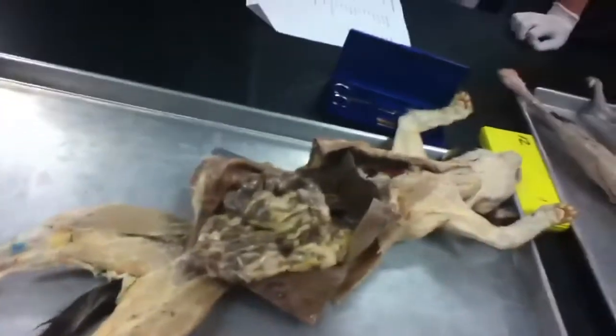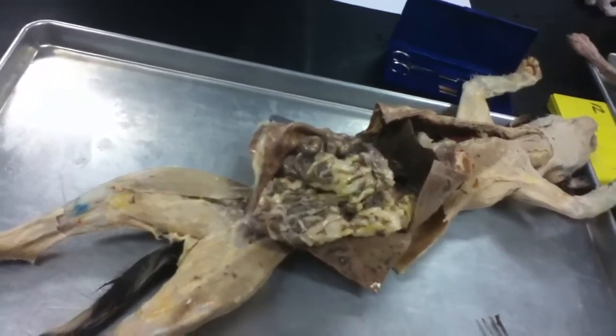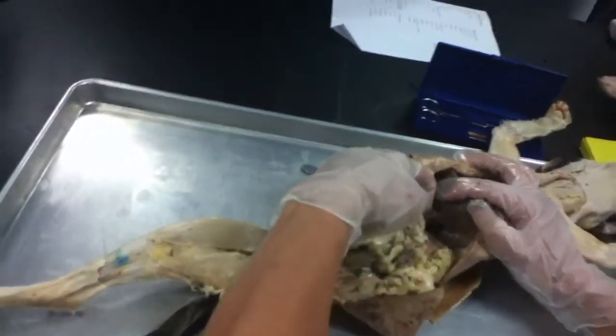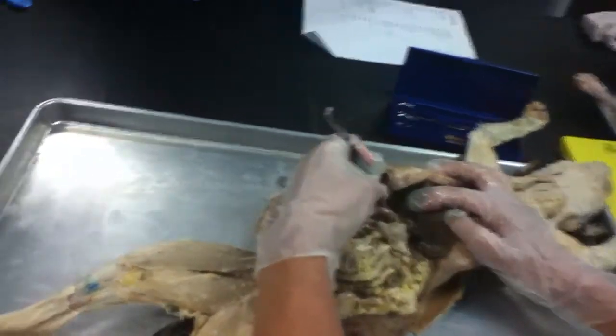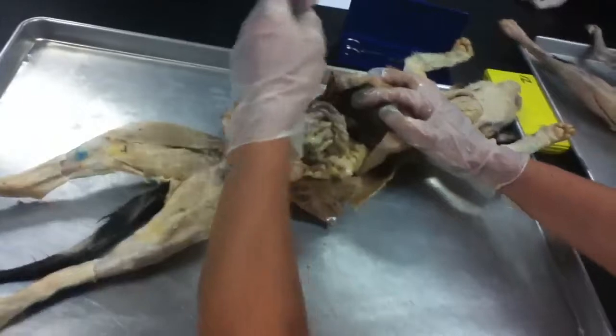Common bile duct. What actually happens is there's multiple ducts. One of them goes to the gallbladder, the other ones go to the liver, and all of them combine, like where my arms are, into what's called the common bile duct. And so when it does that, that common bile duct drains into the duodenum so that the bile can start to break down the fats. Okay, so you need to find that common bile duct. All right.